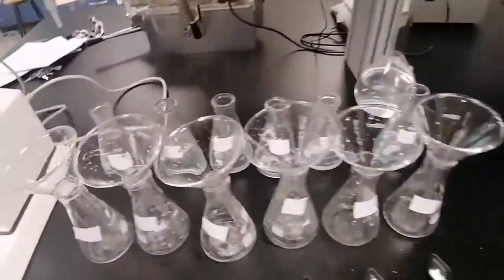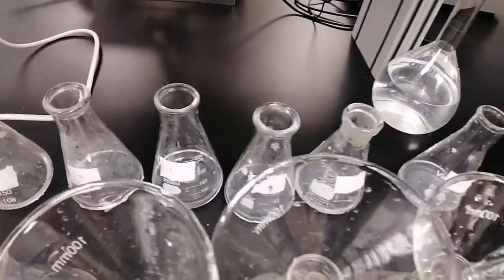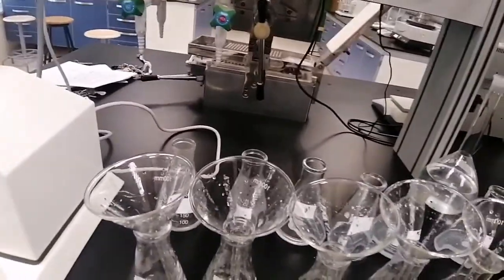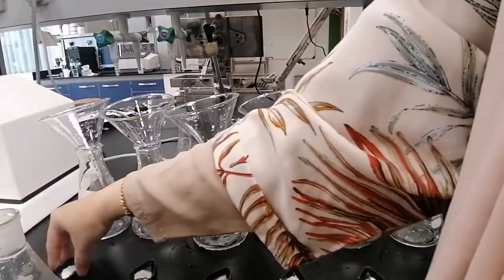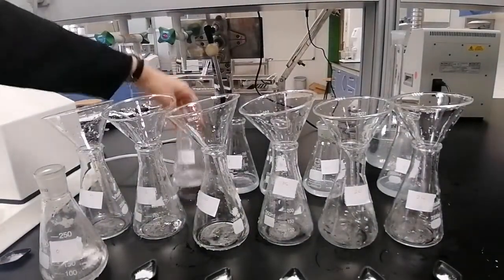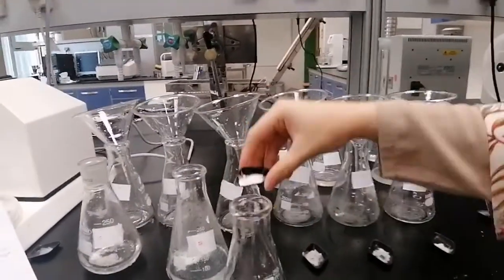The same setup is prepared. Here we'll have 0 concentration or 0 volume of ethanol. Then we will move from 0 to 5, 10, 15, 20, and 25. And we will add the phosphate buffer as prescribed in the table in your manual. We will add the 0.1 gram of mefenamic acid into each solution. And then we will move to the shaker, the same shaker used before, in order to mix the mefenamic acid with these solutions to increase the interface with them.